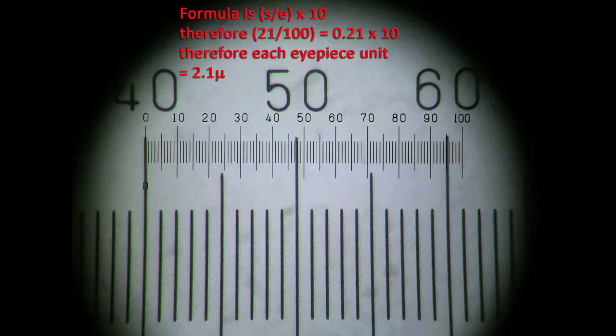Let's see if it applies to an even greater magnification. So once again, center the slide scale in your field of view and switch to the 100x objective.